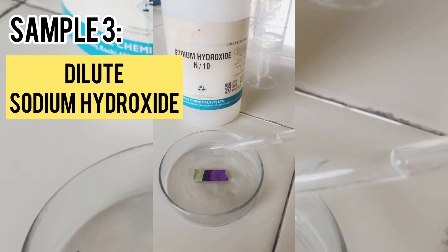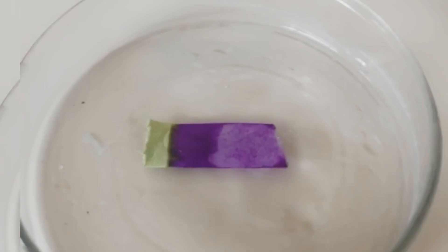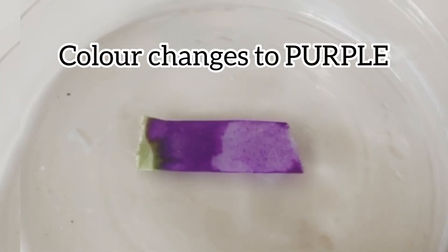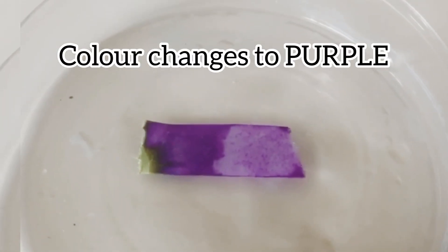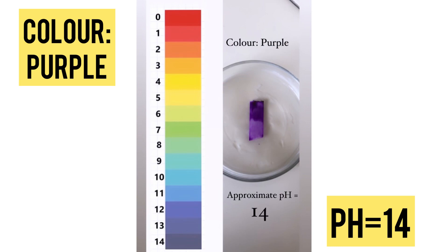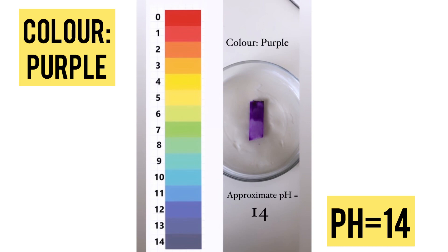Next sample, sodium hydroxide. You can see the color changes to purple. That means pH is corresponding to 14. It is a very strong base.